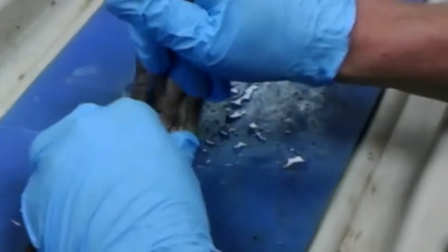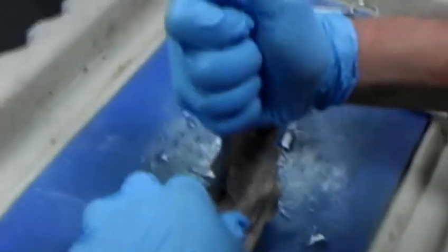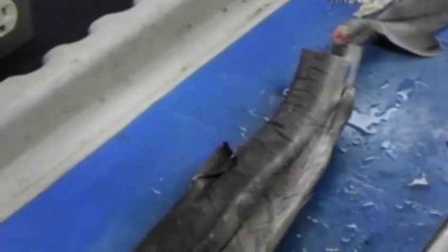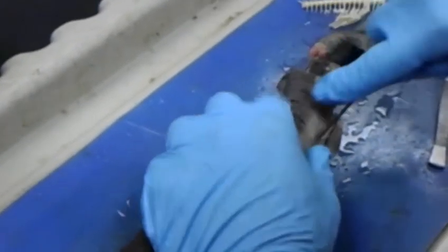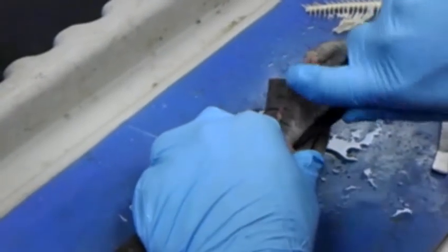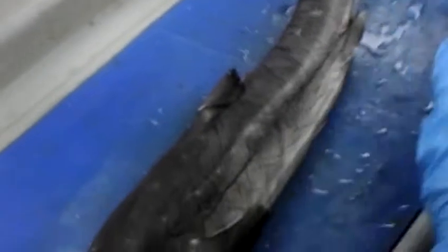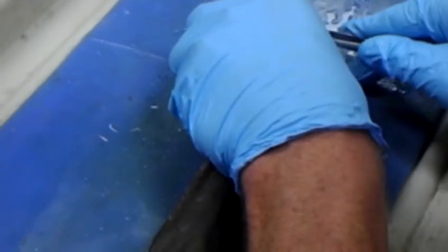Wow, these are really sharp. The ones with blades that can come out are better. Well, we are cutting through a shark. I mean, you can make boots out of this. Shark dermis. It's tough. Apologize if that's not as sharp. I've been using it a lot. I'll never comment on the sharpness of a man's knife. Never. It's a bravado thing.